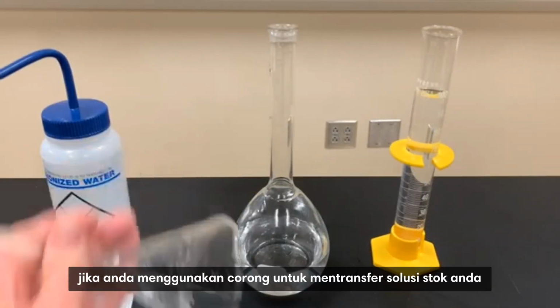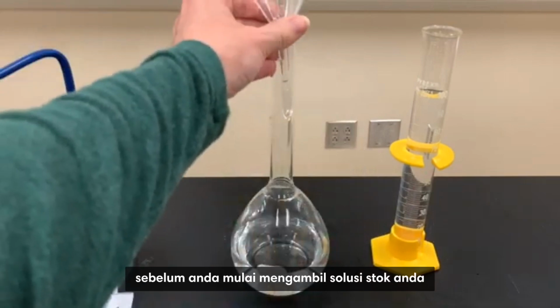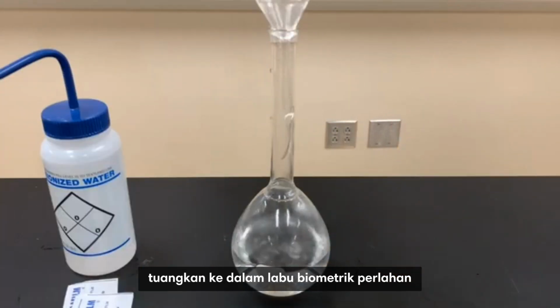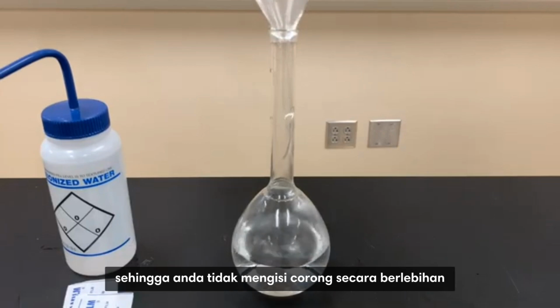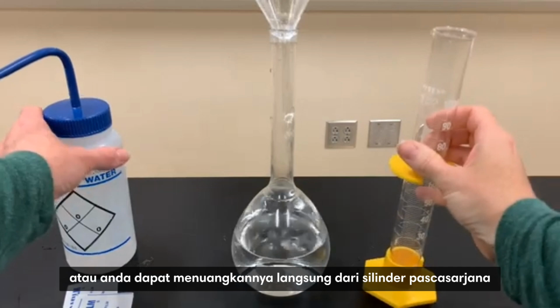If you use a funnel to transfer your stock solution, make sure that you've also rinsed that with some distilled water before you start. Take your stock solution, pour it into the volumetric flask slowly so that you don't overfill the funnel, or you can pour this directly from the grad cylinder.